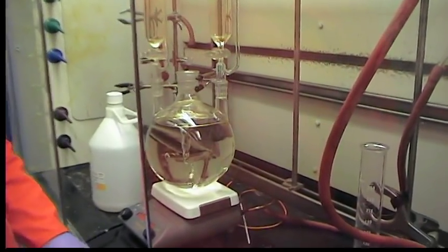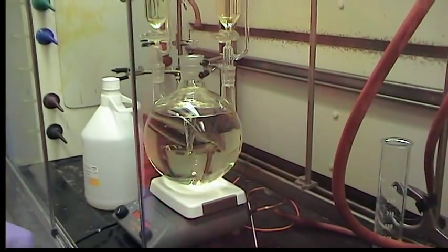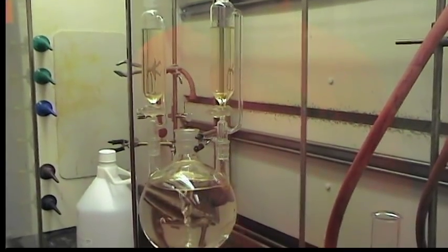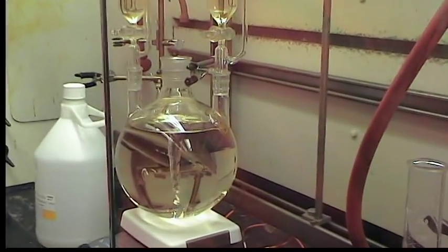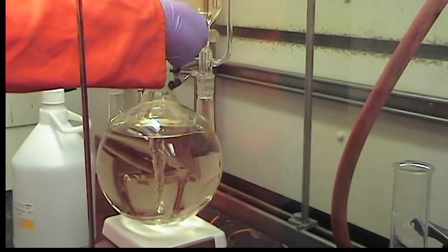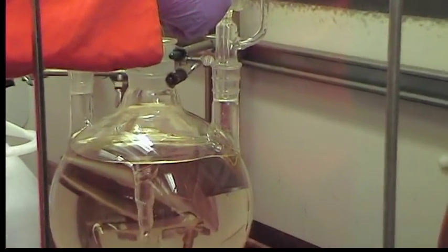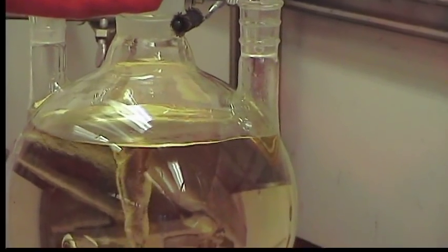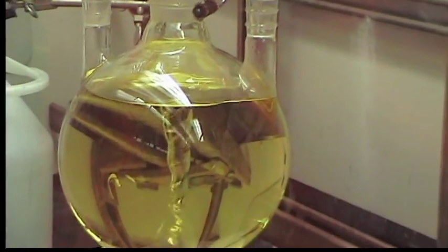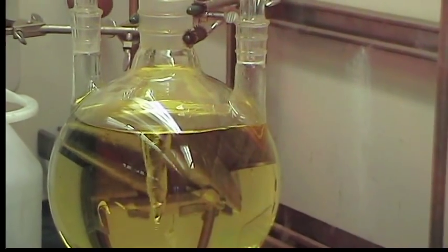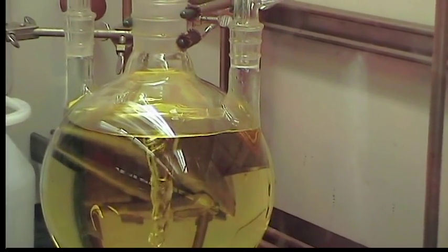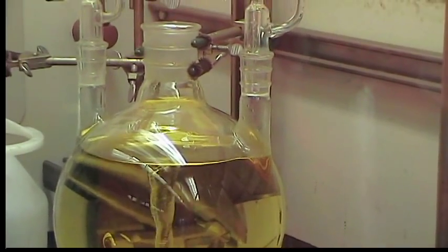Now the pentanone has been added and we're ready to add the tetrafluoroboronic acid. The addition of the tetrafluoroboronic acid is going to lead to an exothermic reaction, so the addition needs to be done very slowly and carefully. I'm going to start adding dropwise, and within a few minutes the color immediately changes to yellow and vapors are formed. It's important to leave the reaction mixture open to the atmosphere and in a well-ventilated environment because acetic acid will slowly be generated and refluxed.